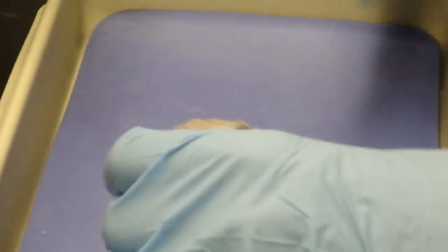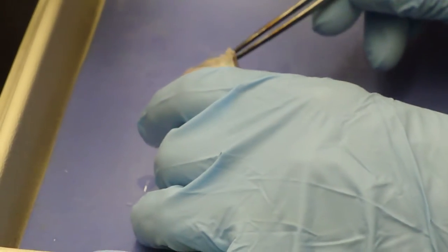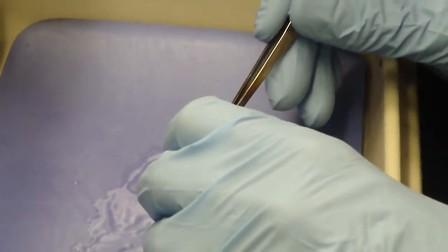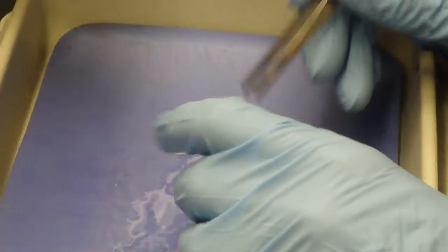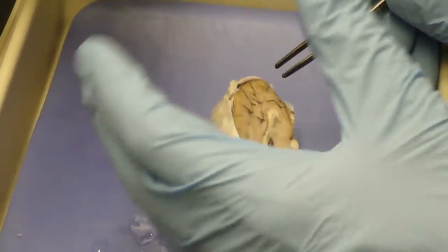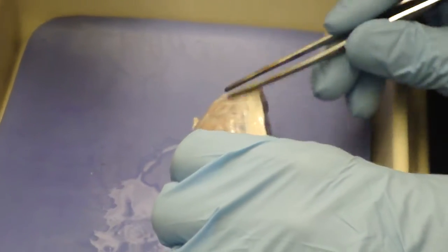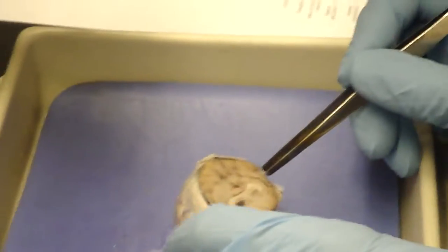The brain is surrounded by a very tough membrane, and that's this. This is the dura mater. The surface of the brain is encased in a membrane called the pia mater. So dura is this slick one you can see. Pia you're unaware of because it's right on the brain.